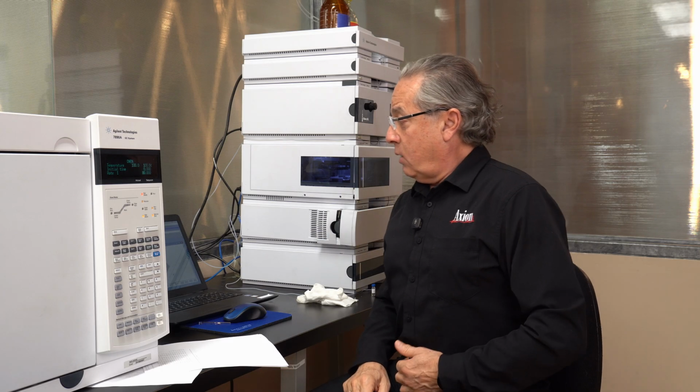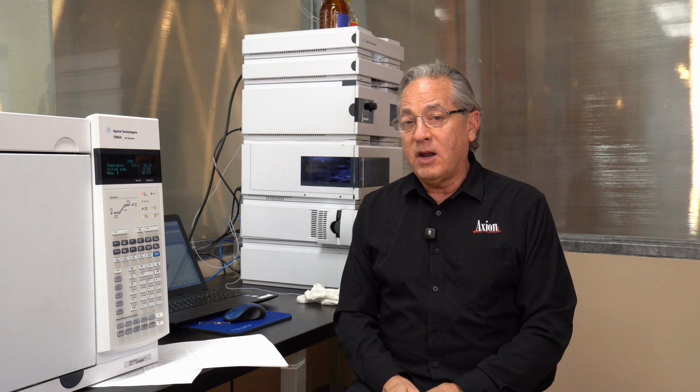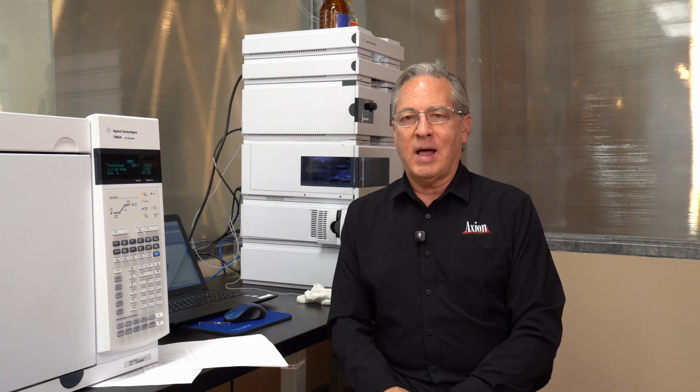Like I said, what I would do typically would be not only clean the liner, change the liner, but I'd change the gold seal, clean the gold seal, and chop off a little bit of column. That'll get that last little bit of tailing under control. So that is as practical as it gets. We are, during method development, we turn into troubleshooting because we see an issue with the peak shape.